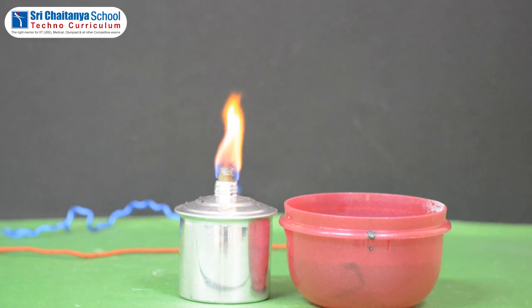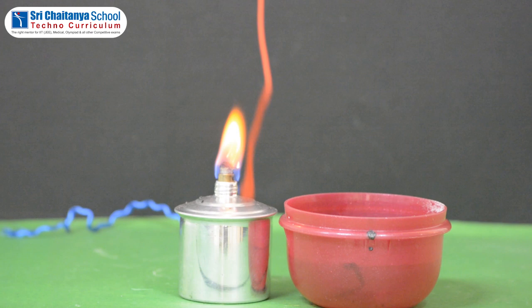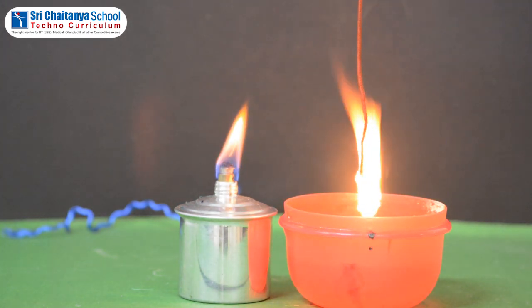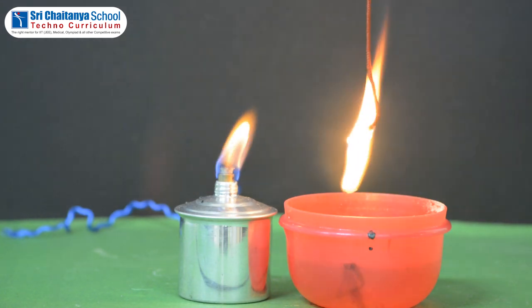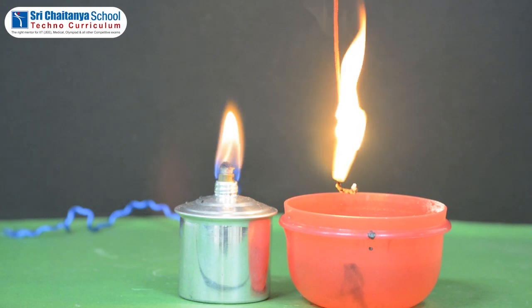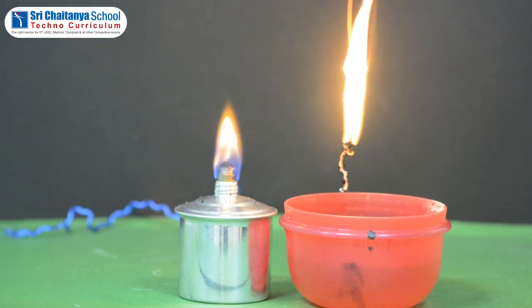Next, hold a small piece of silk with tongs and burn its one end with a spirit lamp. Check the following: how does the fabric catch fire, and the smell after burning. Record your observations in the table.